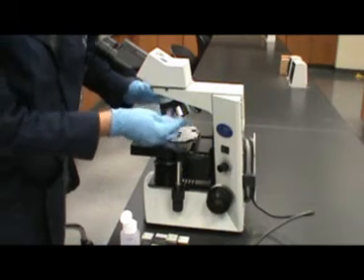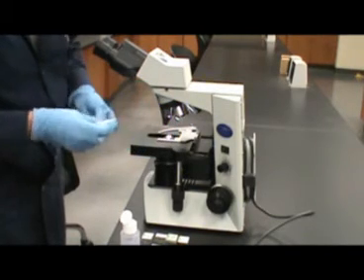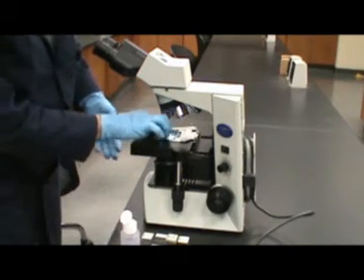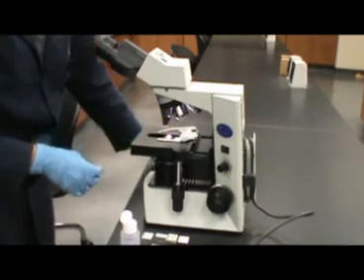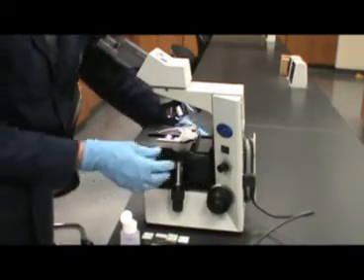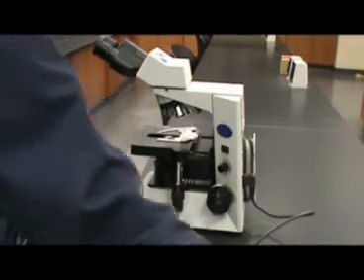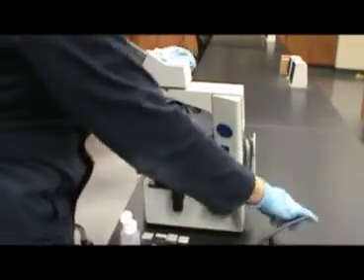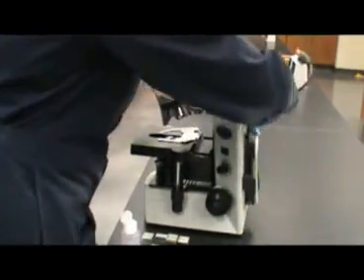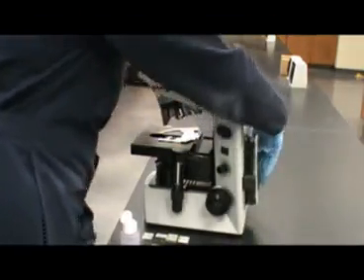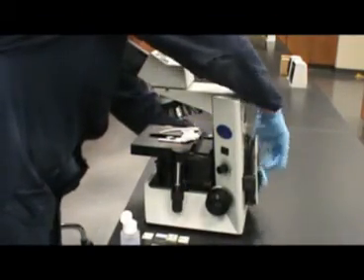Proper cleaning and handling of the microscope after each use is essential to the maintenance of the microscope and will add to its longevity in your lab. Poorly maintained microscopes are difficult to use. Once you have finished cleaning the microscope, make sure that the stage is in its lowest position, the objective is set to the 4x, and the microscope is turned off prior to unplugging it. The microscope should then be replaced in the storage cabinet.